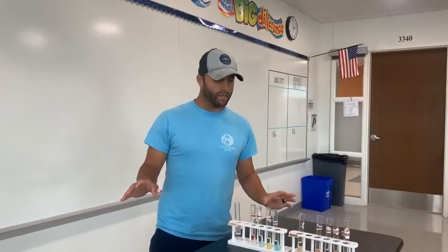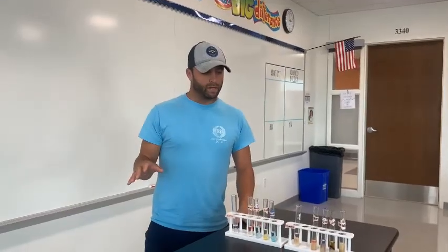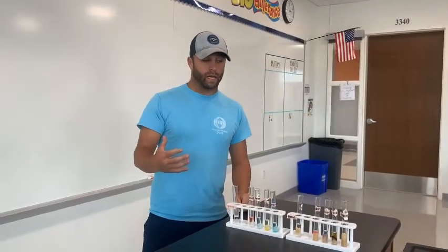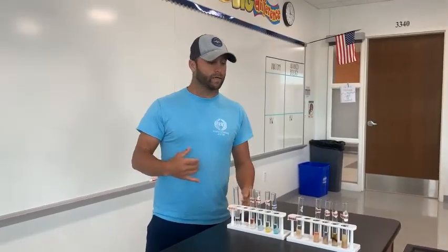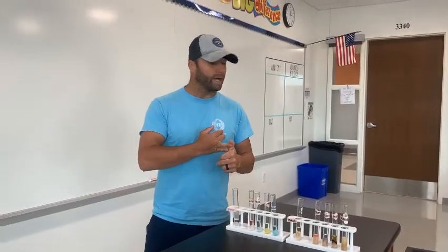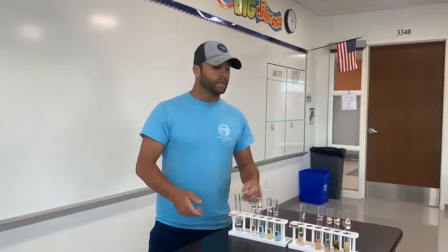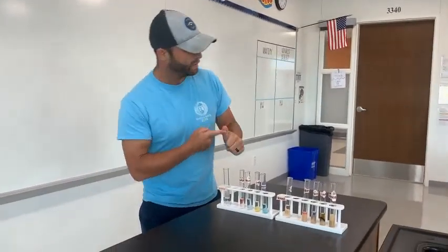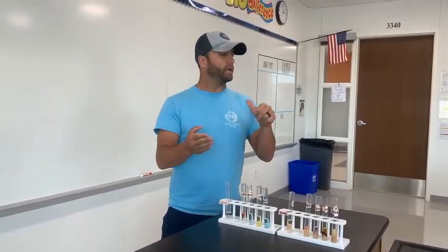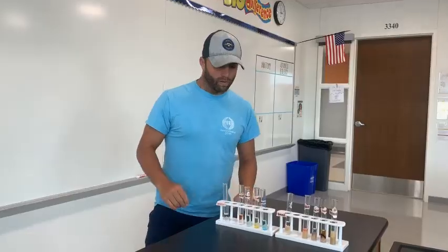Mr. Durham here. I'm going to lead the experiment for the four unknown samples. Ordinarily your lab groups would each bring in one or two items to test, but I just used my lunch today — a turkey sandwich with avocado and a side of Doritos. So what we're going to test today is bread, avocado, turkey, and Doritos.